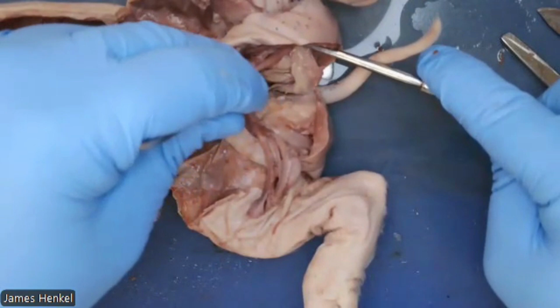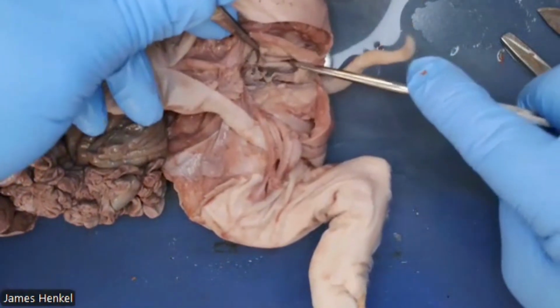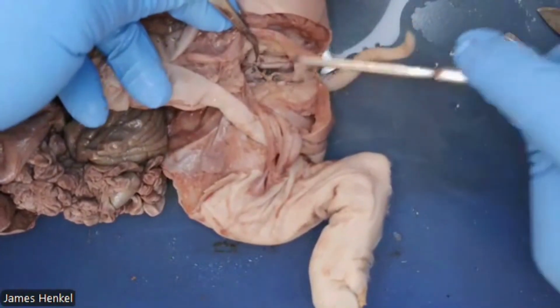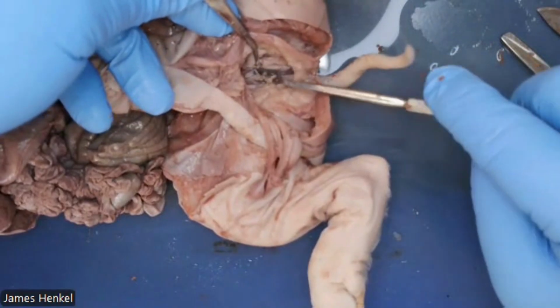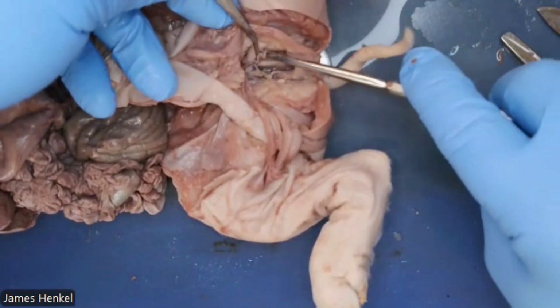You can see that gland underneath. That's an elongated oval that's underneath, that's on the dorsal side. And that's the bulbourethral gland. It's usually a very pale color compared to the other parts of the pig there. So you can see that at the end.